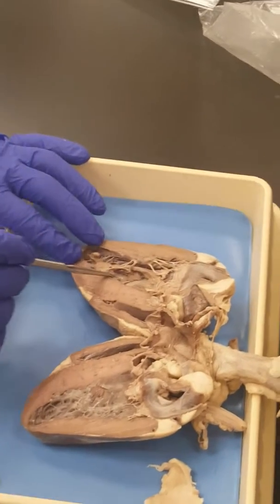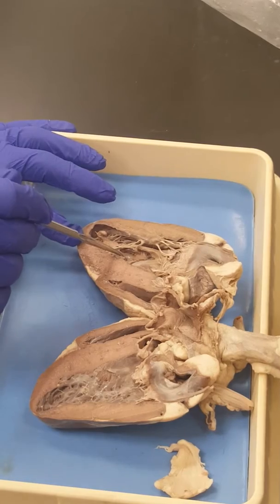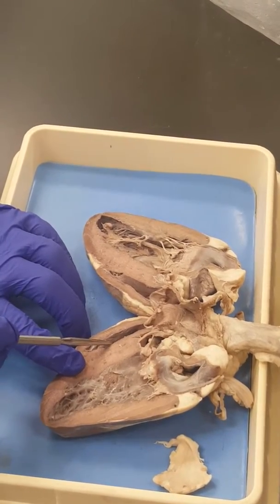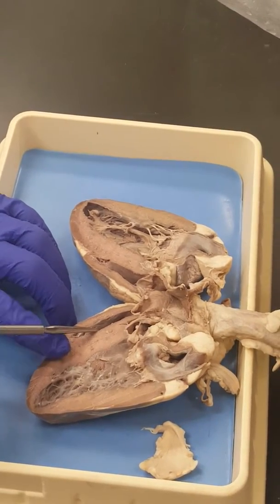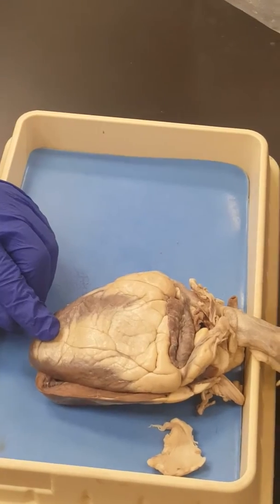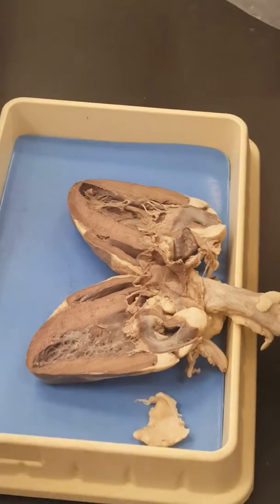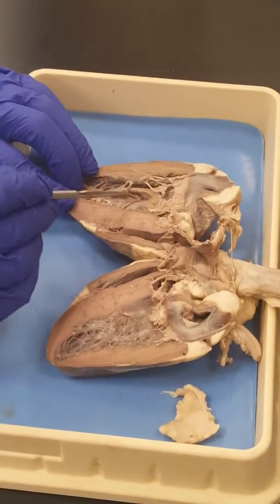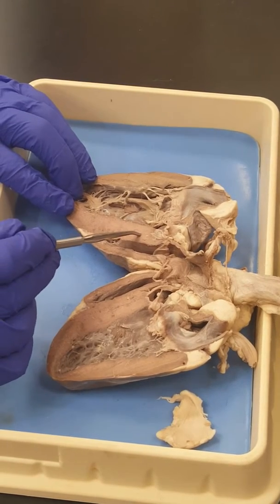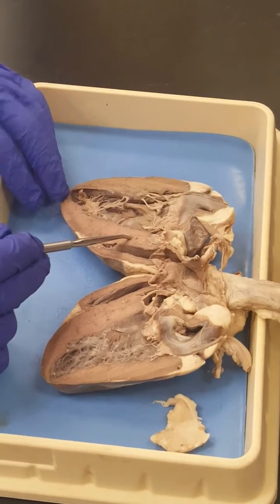So if I put a pin here, I could do that too and say what's that chamber of the heart. You still say left ventricle. If I put a pin inside here and I say what's that chamber of the heart, you still say right ventricle. See what I'm saying? But I could do it out here too, or out there. Okay? As long as I'm saying chamber or as long as I'm saying part, then you know what I'm talking about. So this part that divides the left ventricle from the right ventricle, this is the interventricular septum. Okay? Interventricular septum.